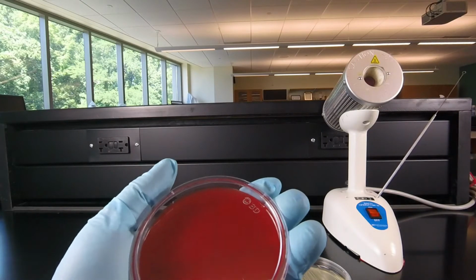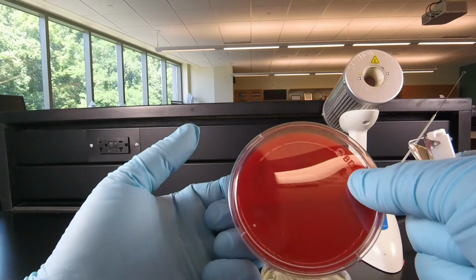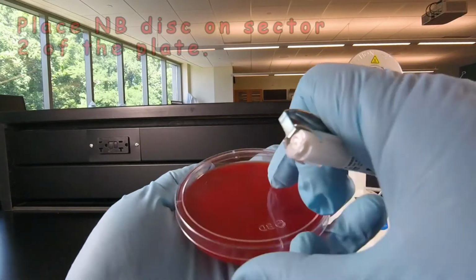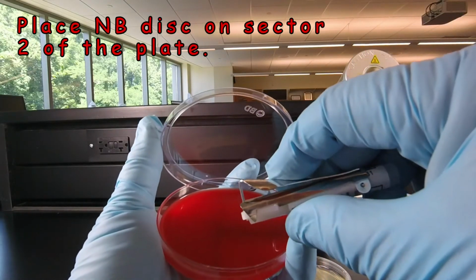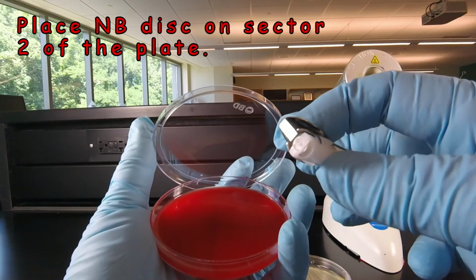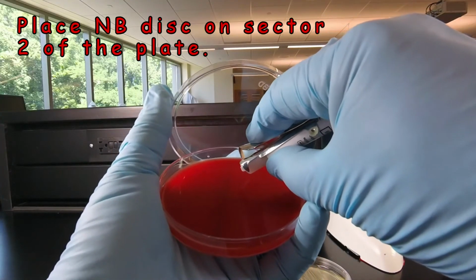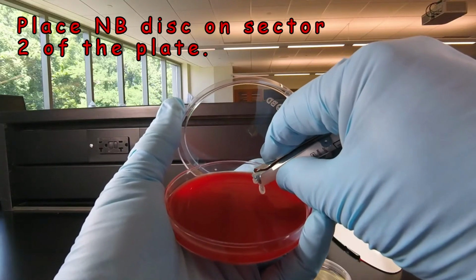Now what we're going to do is place the Novobiocin disc on sector 2 of the plate. And to do that, we lift the lid. Now the way the dispenser works, when you push down on the handle here, that will eject a Novobiocin disc. So we hold it over the area where we want the disc. We push the lever down, the disc comes out.